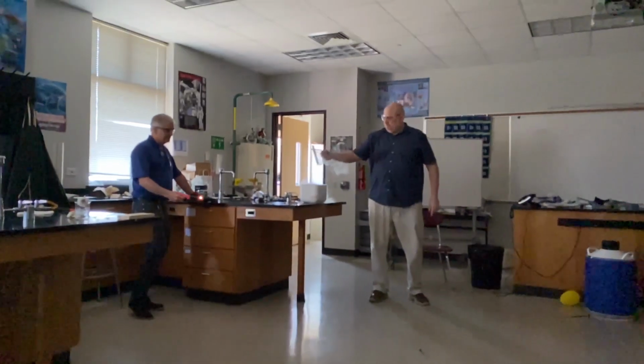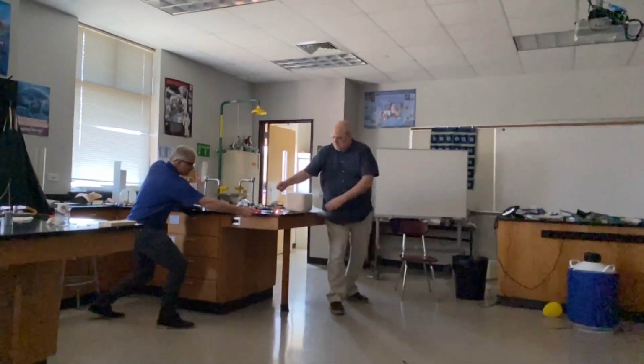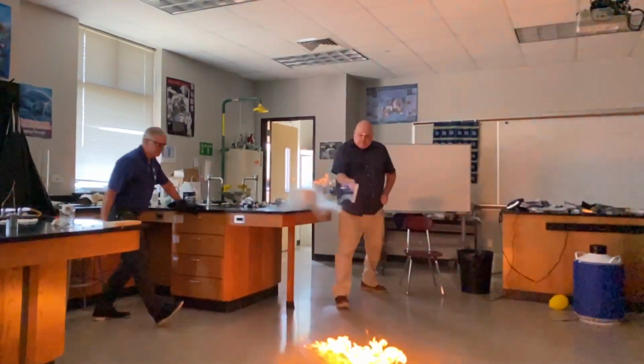We're going to pour it on the table. And let's see what happens. Yay. Oh, yeah. Whoa.